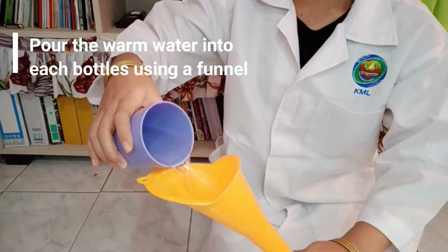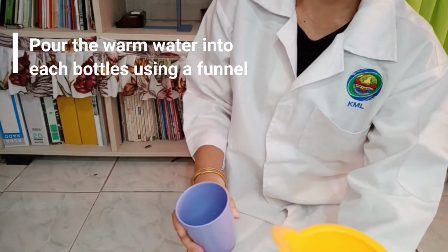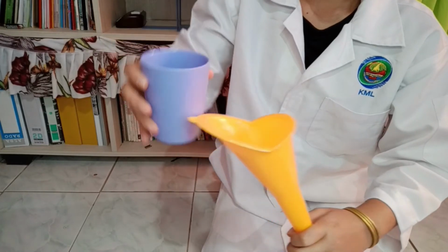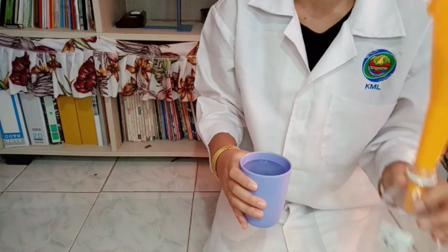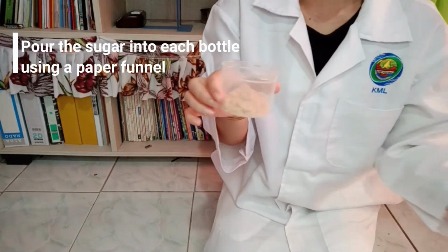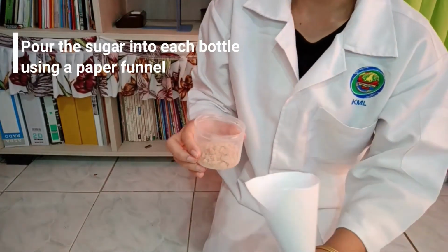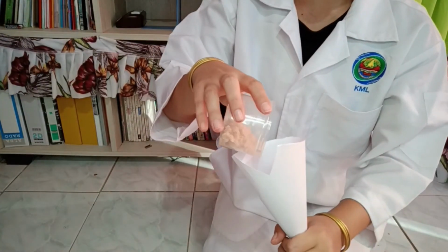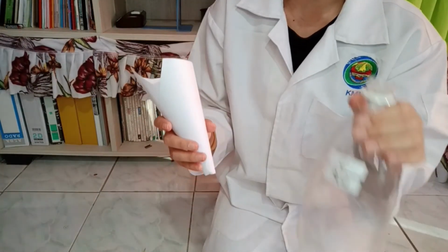Next, pour the warm water into the labeled bottles, where bottle A represents water, bottle B represents alkaline, and bottle C represents acid. After that, I use a paper funnel to pour the sugar and yeast into each of the bottles.